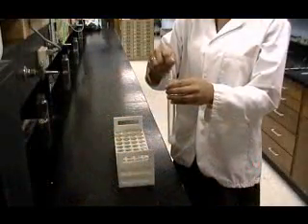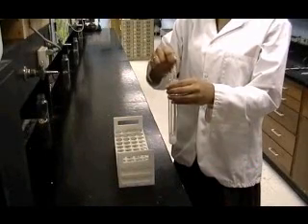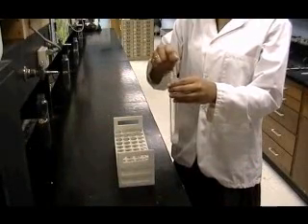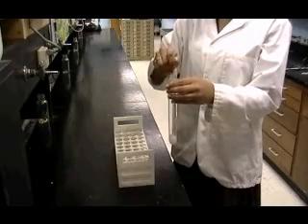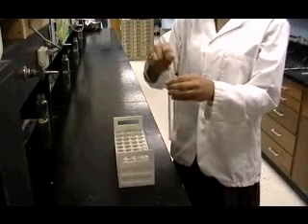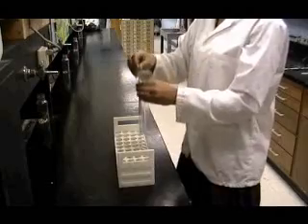Now, use a long stirring rod to stir the mixture until the salicylic acid dissolves. Keep the stirring rod in the test tube and place the test tube in a test tube rack or suitable holder while you proceed with the next activity.